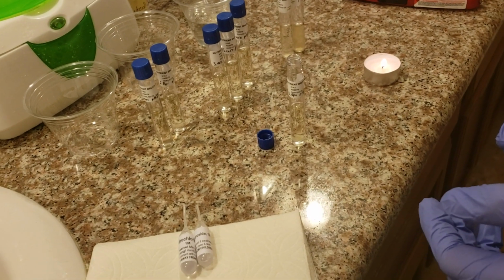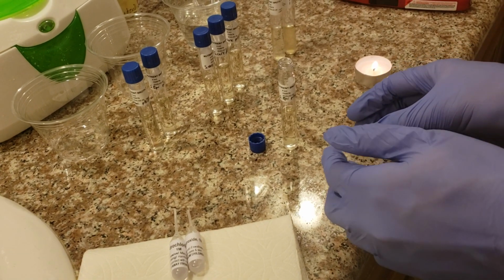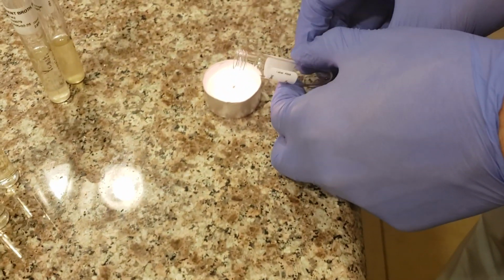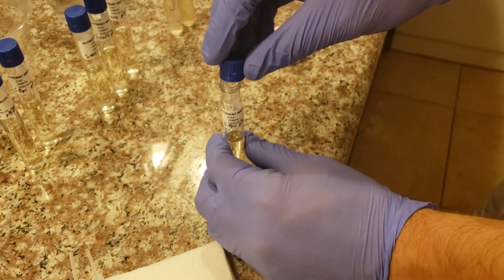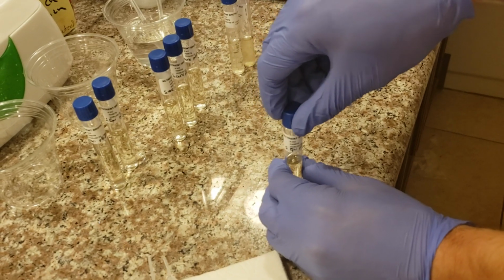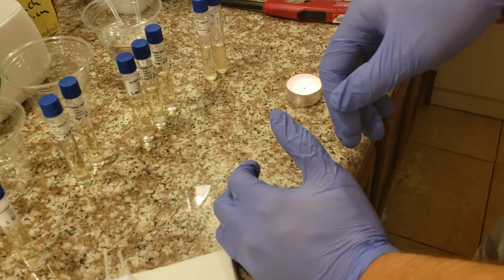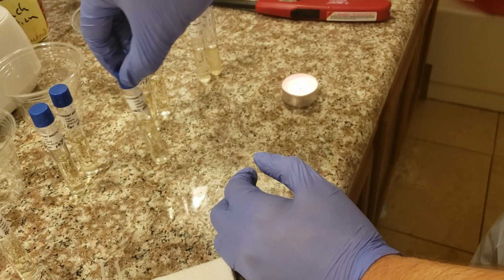All right, so next I'm going to pass the opening of the broth tube over the candle flame to sterilize it once more. Okay, that's about good. And reaffix the lid. Okay, the lid is reaffixed. Brilliant. Next, I'm going to repeat steps 9 through 11 with 1 drop of hydrochloric acid for the S. cerevisiae pH 5.